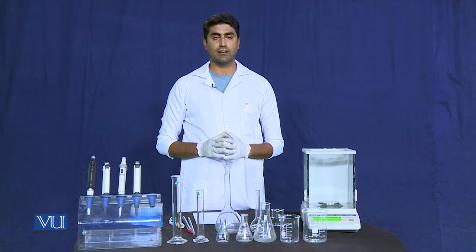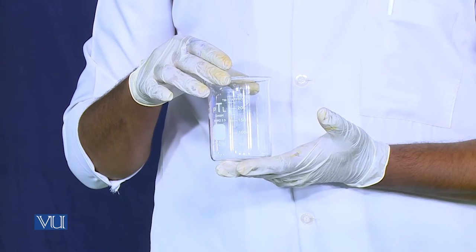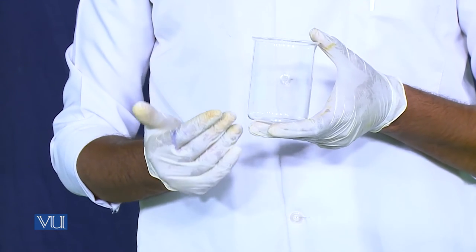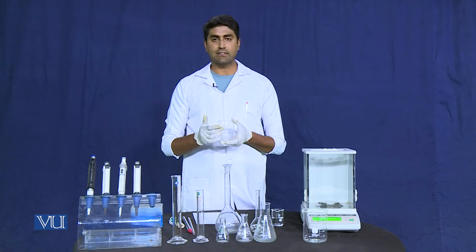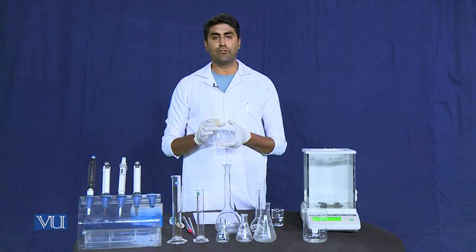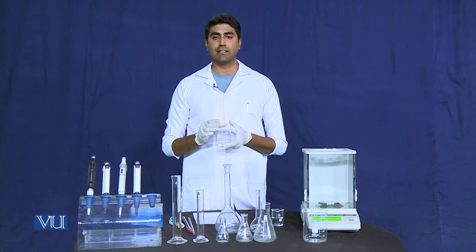Coming towards the glasswares, the first glass equipment we have is a beaker. Beaker is considered to be the workhorse lab equipment of any laboratory. It comes in different sizes and has a flat bottom and wide mouth. It has various volume capacities — this beaker can measure volume up to 250 ml. However, measurement of volume through a beaker is not considered very precise because there are chances of 5% instrumental error.